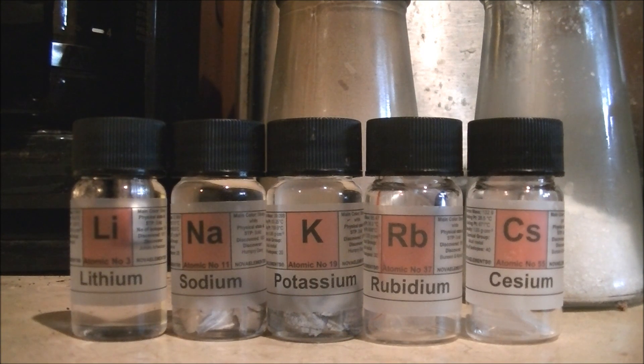For this month's science video, I'm going to be demonstrating the reaction between various alkali metals and water. Please do not try this at home.